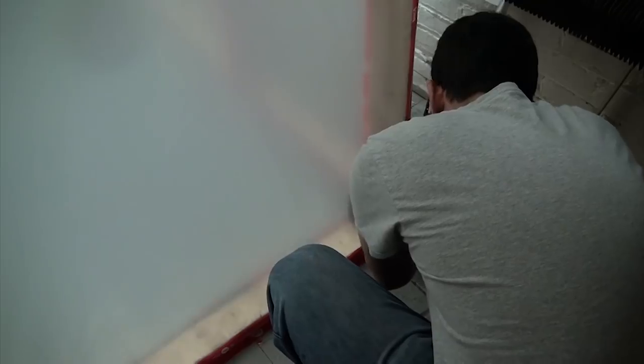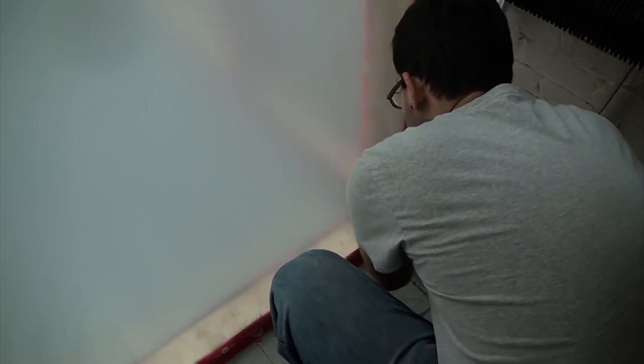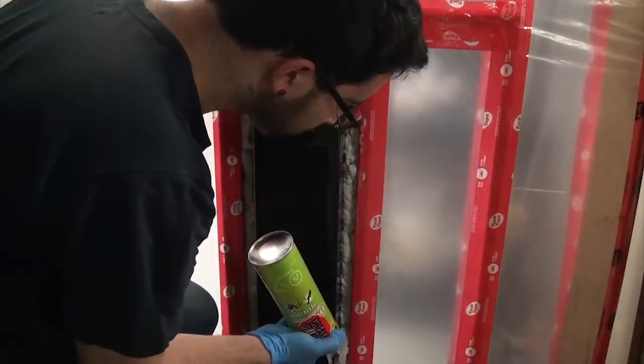In order to power everything inside the lab, we made a port out of a piece of PVC tube which was secured to the bottom corner with more tape, and then power cables could be fed through and sealed in place. Finally, the air filtration unit could be installed by cutting out a hole in the plastic, fitting in the unit, and filling the gaps with some spray foam.